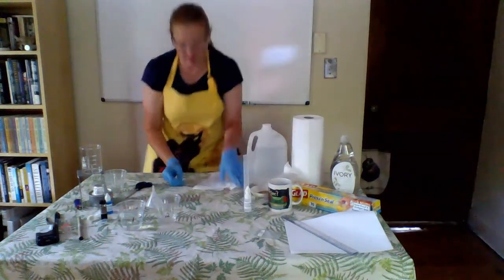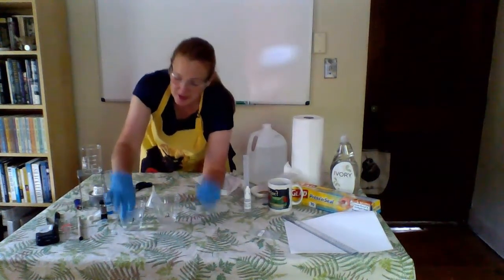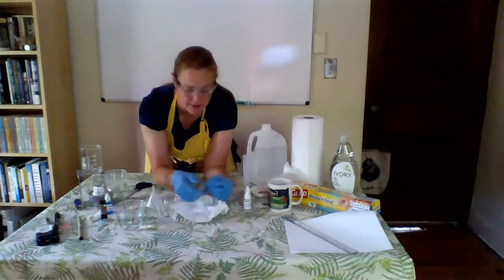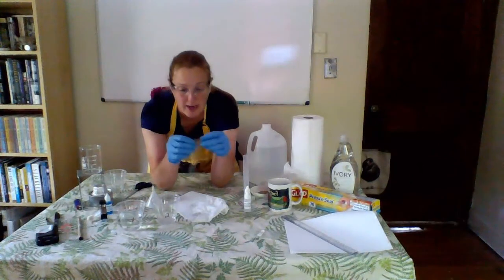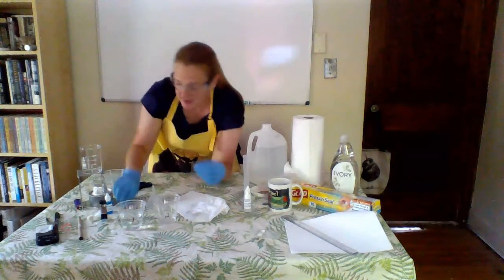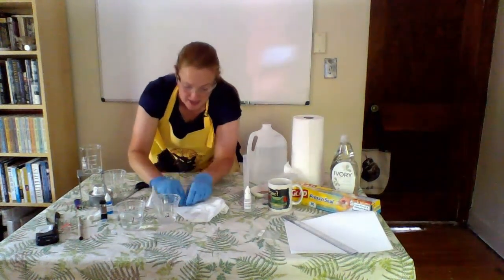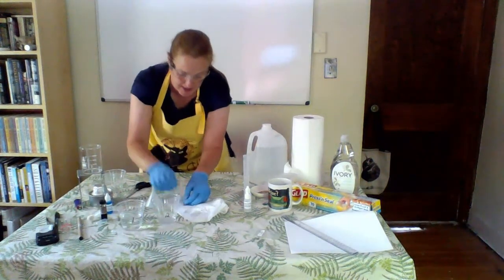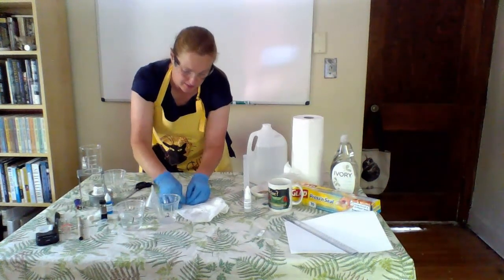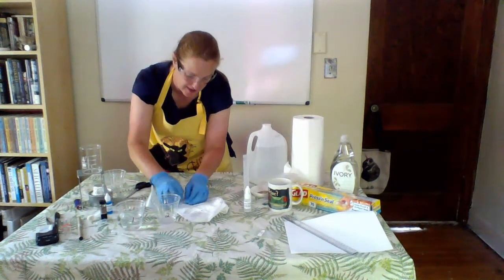Hopefully by now, my dialysis tubing is soft enough to work with. So the trick here is to not let it dry out. We want to move relatively quickly. So on one end, I'm going to give a couple good folds, and I'm going to take my cut rubber band, and I'm going to use this and tie a super tight knot here. We need this really tight. We do not want our cell to leak.